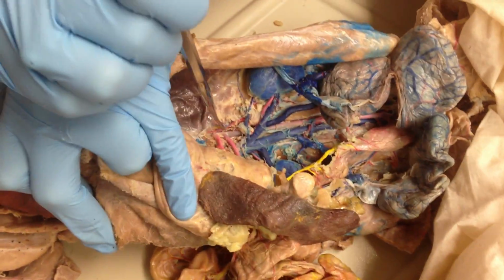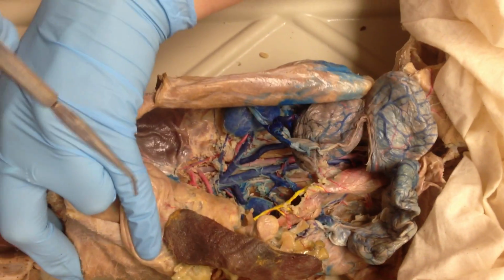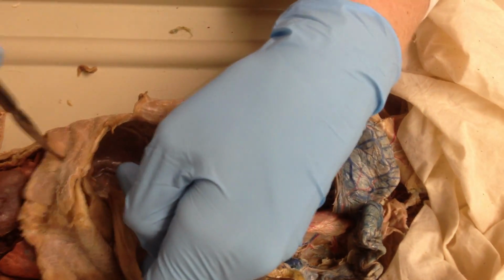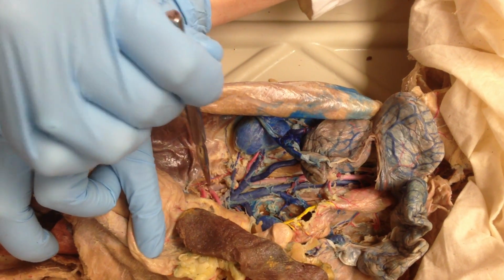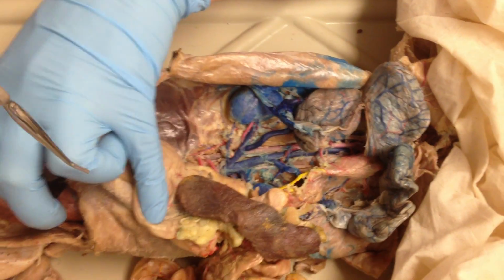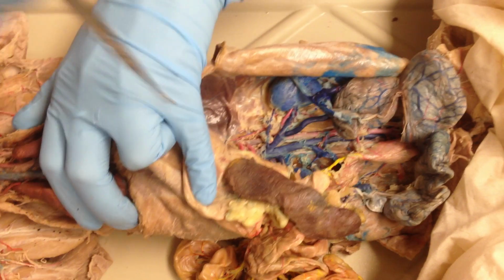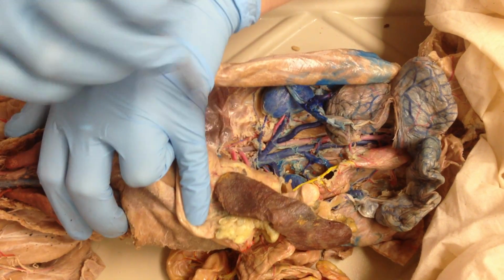Okay, so you've got your abdominal aorta. Your thoracic aorta isn't something you're going to be able to see with this dissection because it's in the middle, under where your diaphragm is. So the portion that you're going to see down here is your abdominal aorta. And the whole thing is descending, starting with the arch of the aorta. It's just there's different pieces of it. So this is the abdominal portion of your descending aorta.